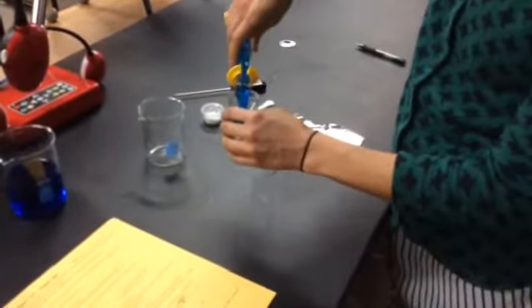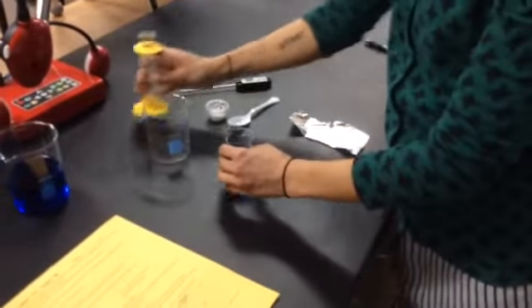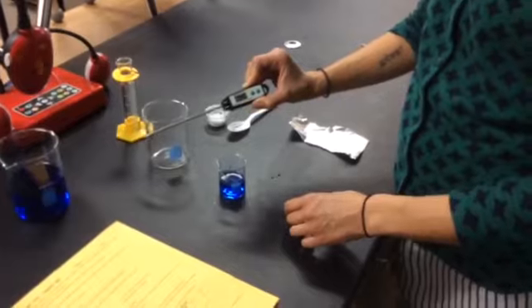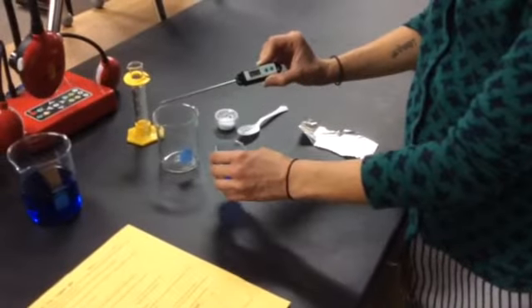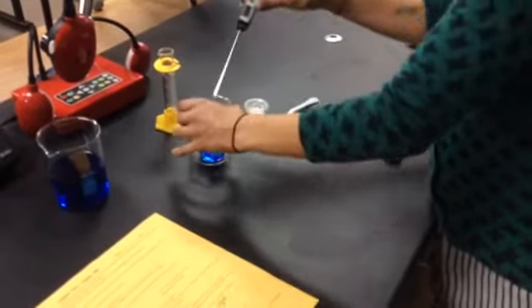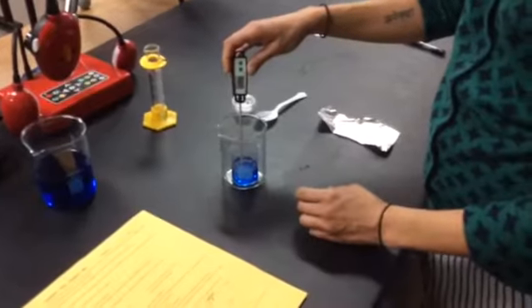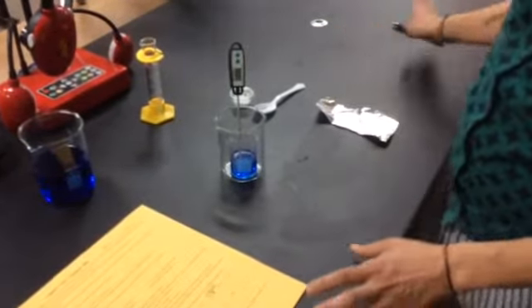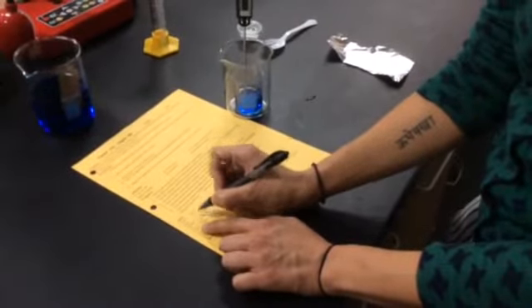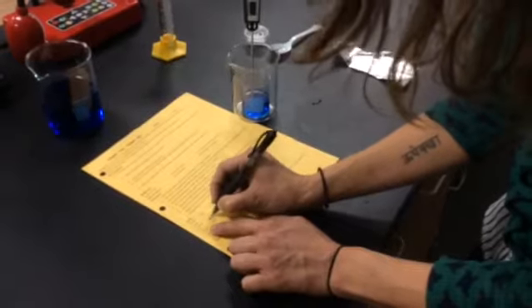And then in the small beaker, we're going to take an initial temperature reading in Celsius. So make sure your thermometer is set for Celsius and place that inside the small beaker. Place that little beaker inside the larger beaker, just to stabilize the thermometer so it doesn't fall over. Let that sit there and get your first reading, which you'll record on your data table at 0.0 time, your initial reading of temperature.